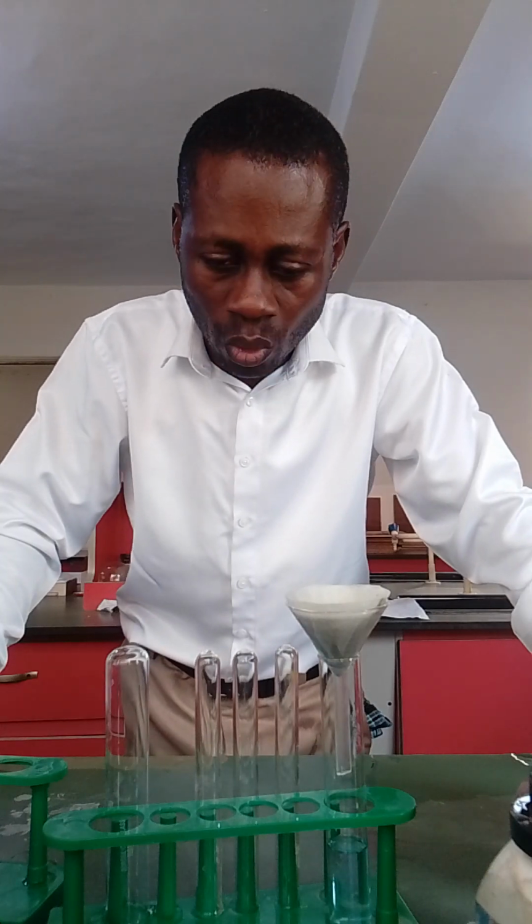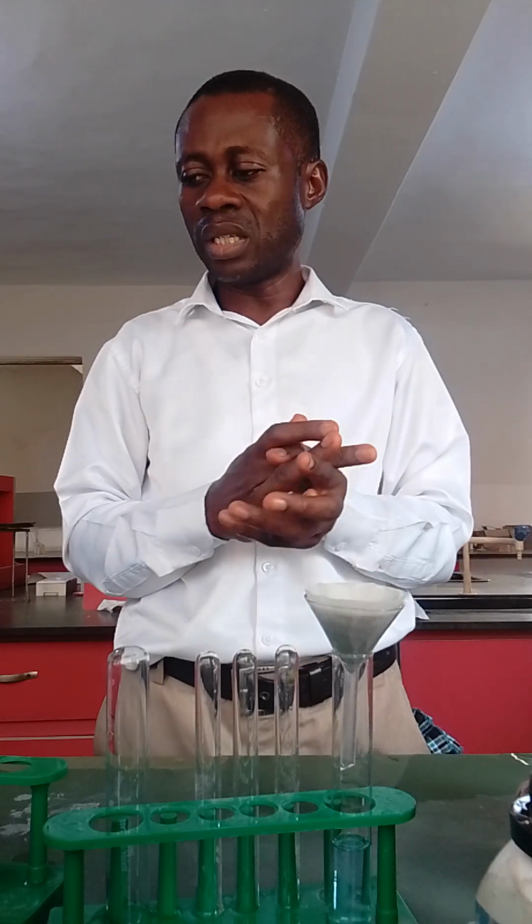The only thing you will change here is that when you have the sample plus distilled water, they may give you the volume of distilled water. It could be 5 cm cube, it could be 10 cm cube. So when you have the volume of the distilled water and you mix it, that will be under your test: sample C, sample D, or whatever sample it is in your question, plus distilled water, and then you filter. That will be your test.